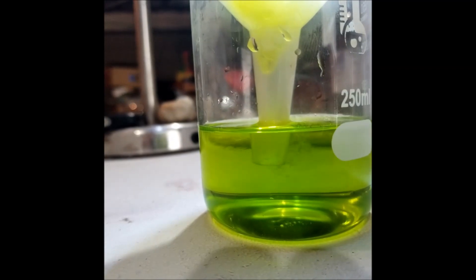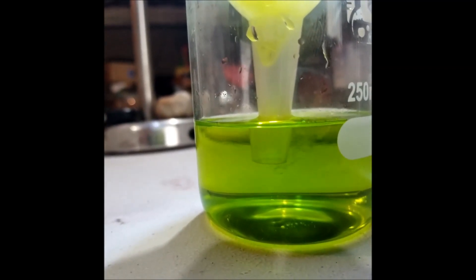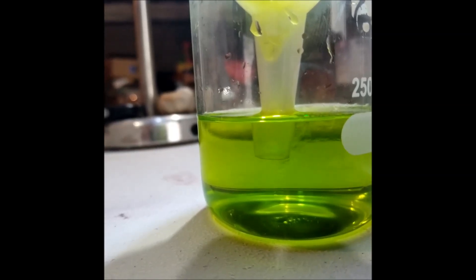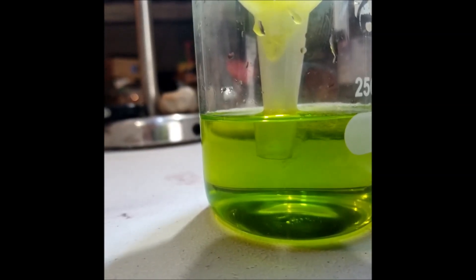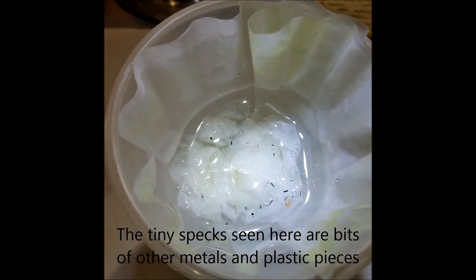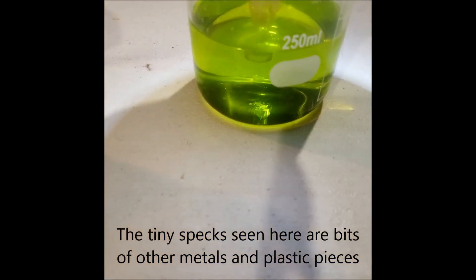I poured some water through the filter just to get all the yellow out, and you can see its different density coming out the bottom of the funnel. It will eventually mix with the aqua regia, no harm done. And with water coming through the top, it has cleared up nicely. Just ensuring that all the dissolved gold liquid ends up at the bottom.